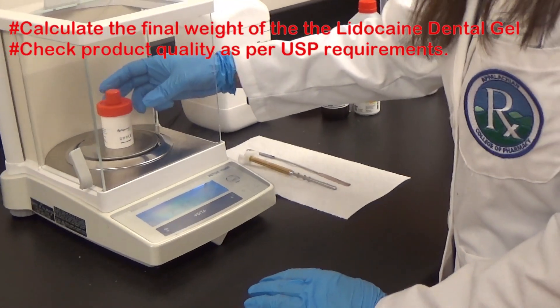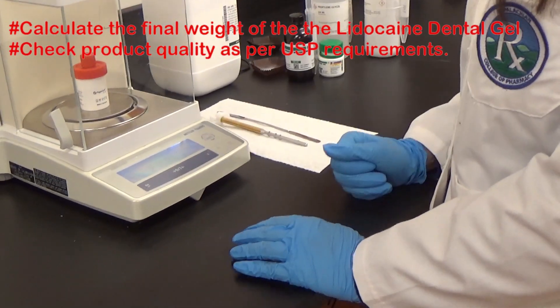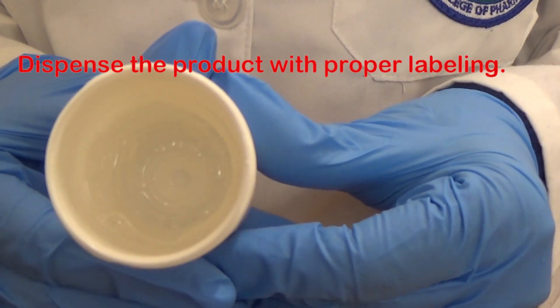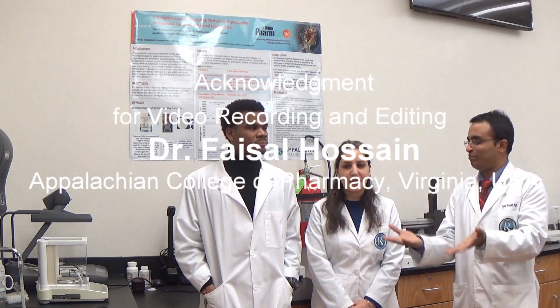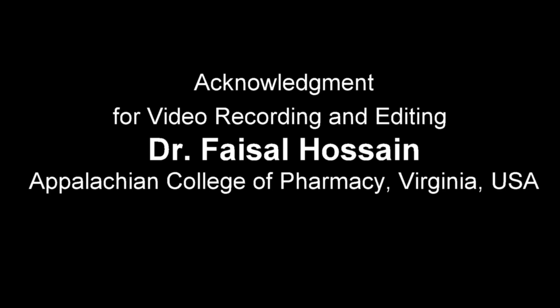Calculate the final weight of the gel, check product quality as per USP requirements. Thank you very much.